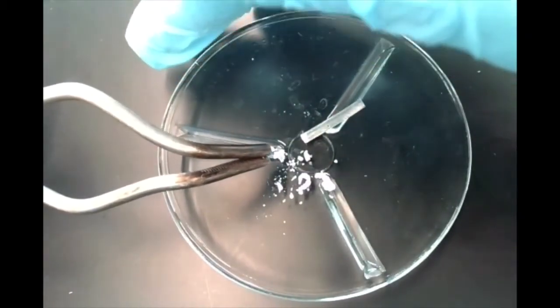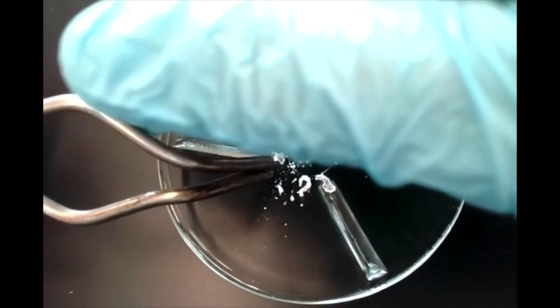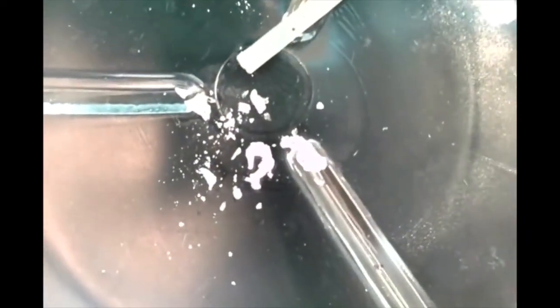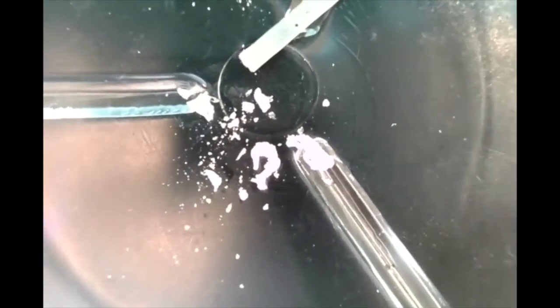If I block off the light there, you can see it's still gray in color, but the magnesium product, which is magnesium oxide, is a white powder. See if I can block off the light there a little bit. There we go. I should be able to see both of those pretty clearly. All right, so notice that the magnesium metal reacted with oxygen gas in the air when it ignited, and it formed magnesium oxide as the product.